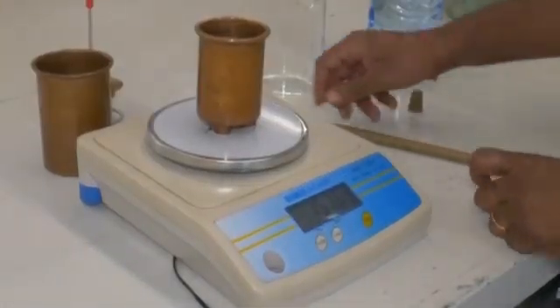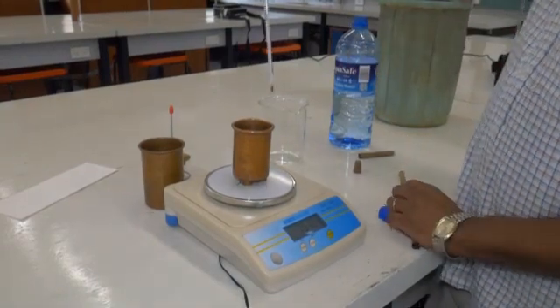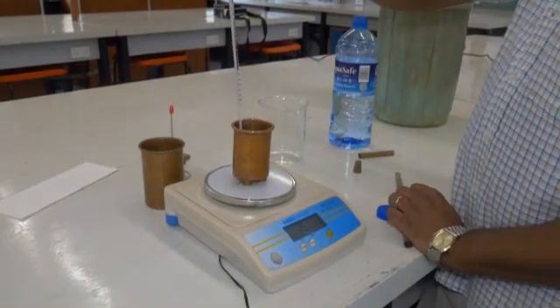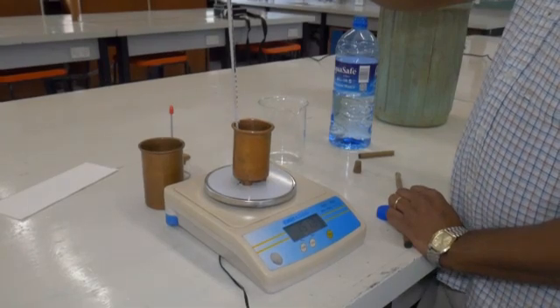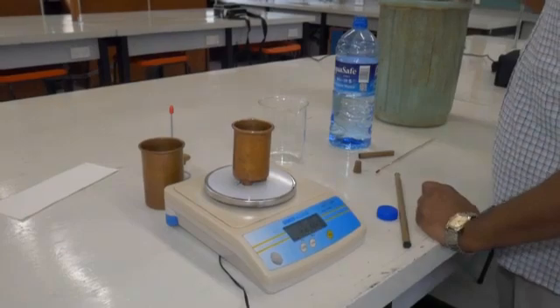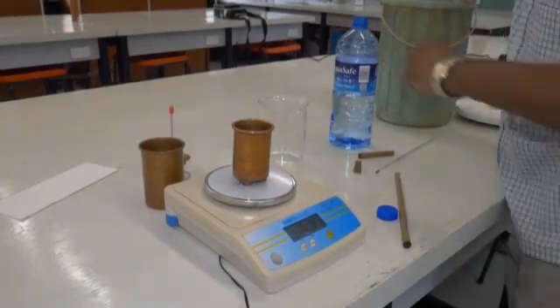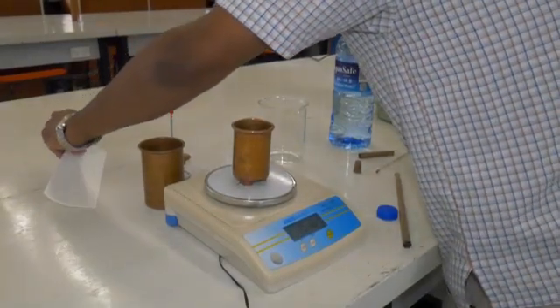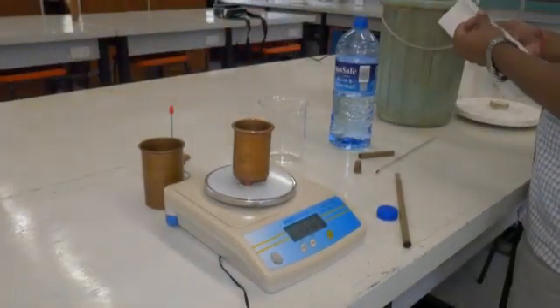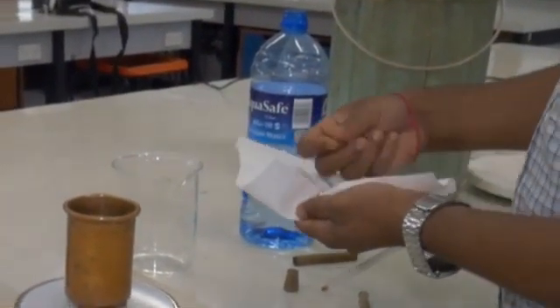Once you have done that, you will take the initial temperature of this water and record it in the results table, right? Now, you'll place 2 cubes of ice in it. Make sure that your ice is clearly white so that there is no adhering water on it.